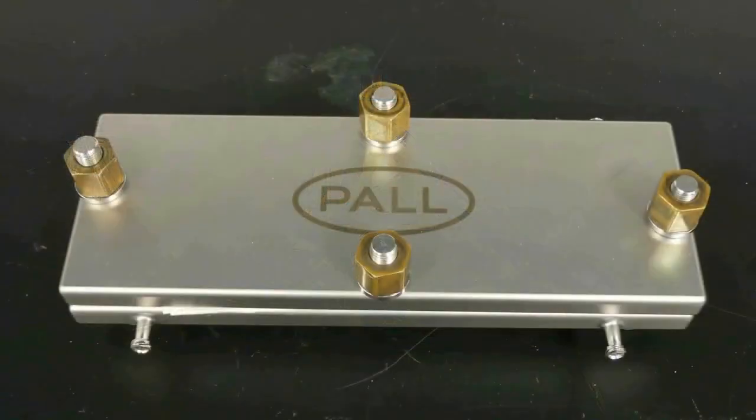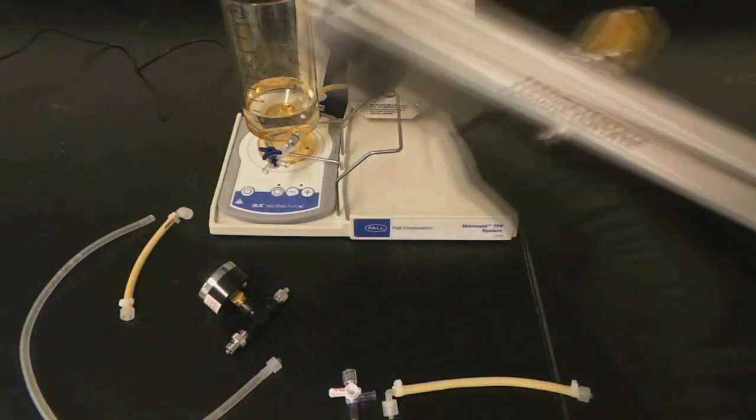The LV CentralMate holder can also be used with the MiniMate system. You will need more tubing along with another pressure gauge.